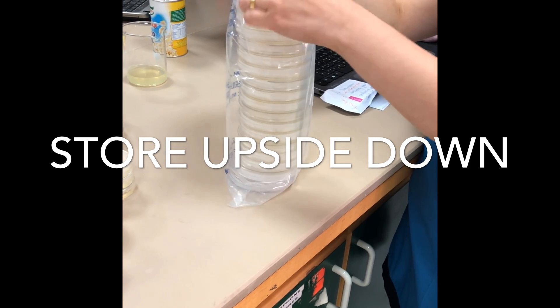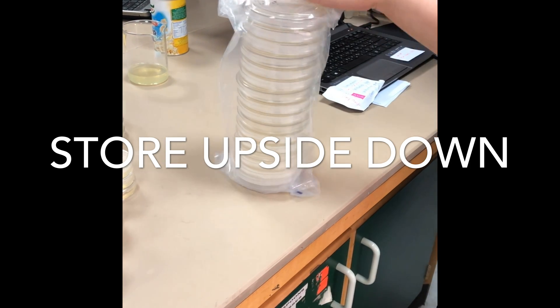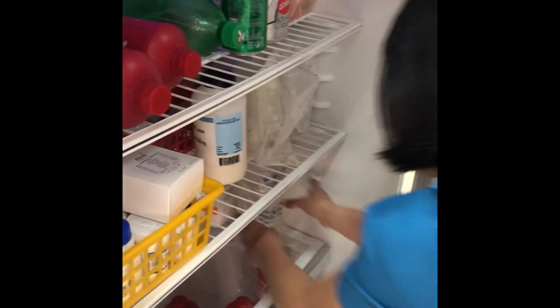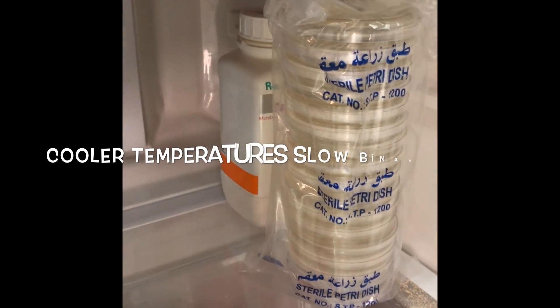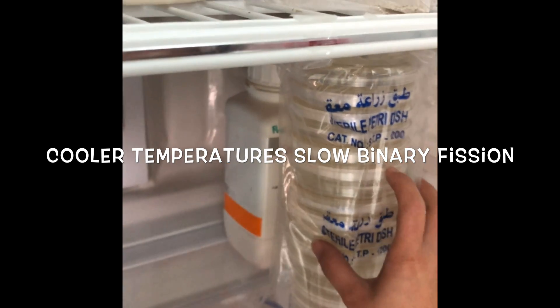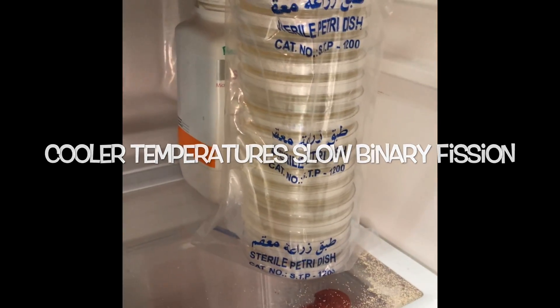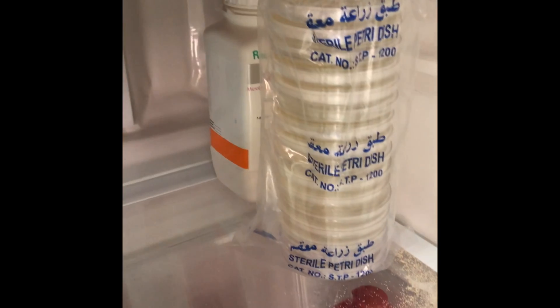The moisture will sit on the lid instead. We stack the agar plates together — we don't want to seal them with sellotape at this stage, but we make sure the lid doesn't fall off by putting them back into the packet and into the fridge to keep them fresh. Storing them in the fridge will slow or prevent any bacterial growth in case there has been any contamination.